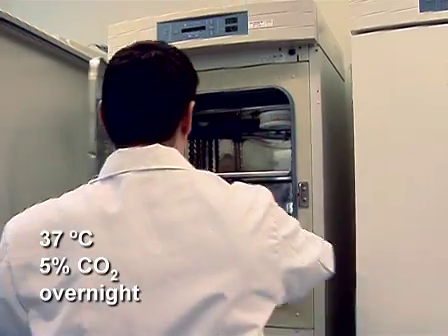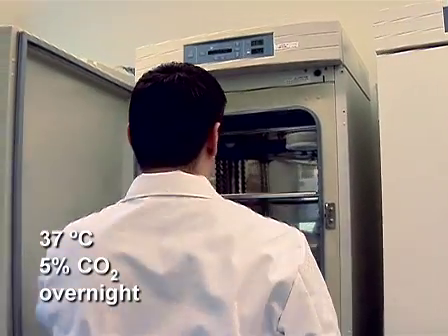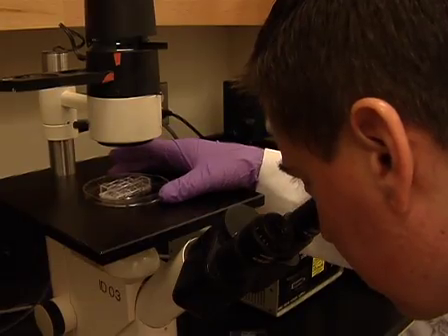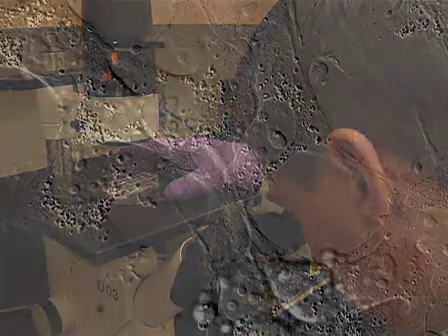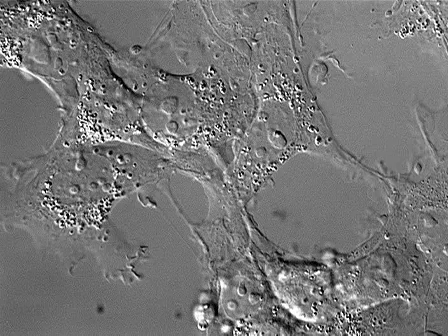Incubate samples at 37 degrees Celsius, 5% carbon dioxide, overnight. On the following day, check the cell culture chambers for cell density and health.